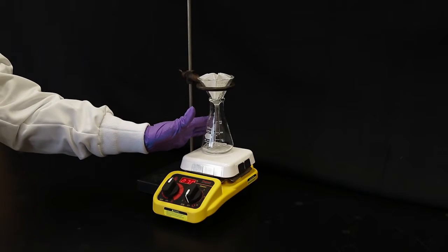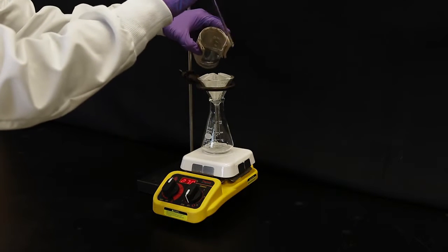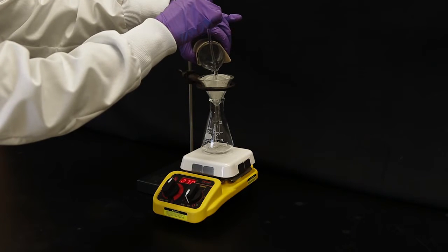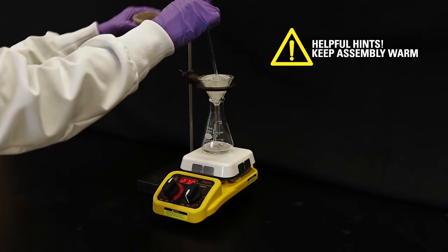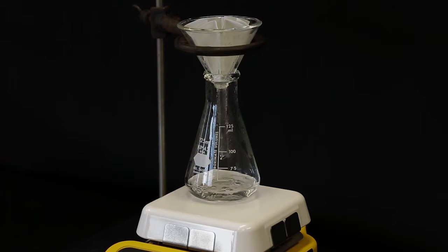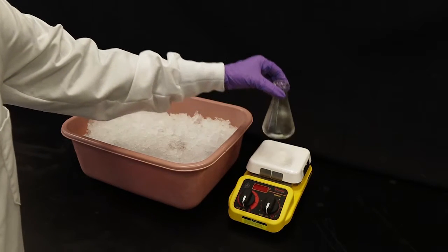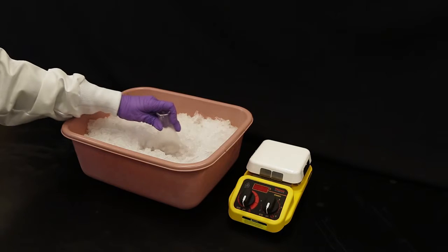When the assembly is warm to the touch, pour the beaker of solution over the pleated filter paper and let it drip into the warm Erlenmeyer flask. By keeping the assembly warm, you will avoid the loss of any material due to early crystallization. After all of the solution has been filtered into the Erlenmeyer flask, transfer the flask to an ice bath.